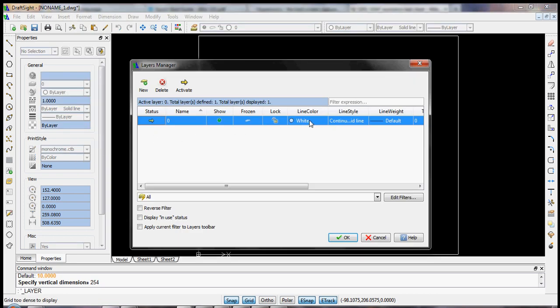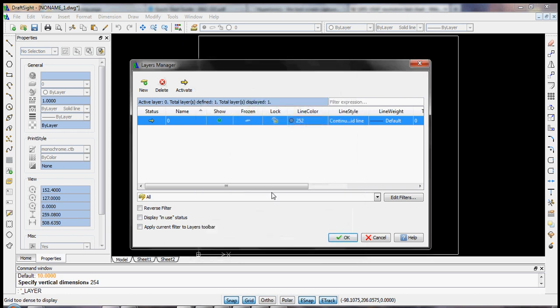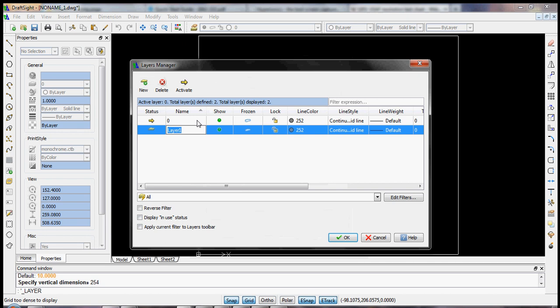This is a white color. Let's change it. Let's make it a little bit dimmer by specifying that it can be some shade of gray, just so it doesn't stand out quite so much. And let's make a new layer. We'll call it Layer. And we will make this, let's make it green.